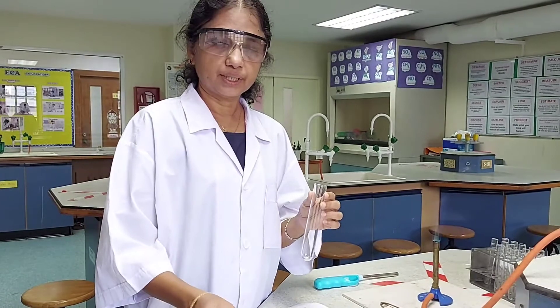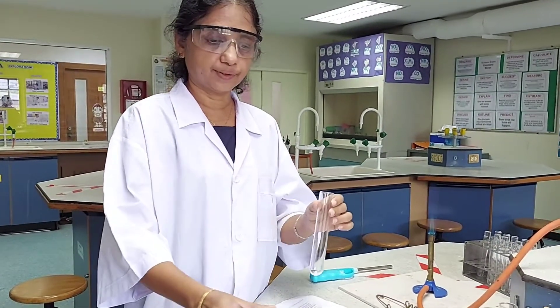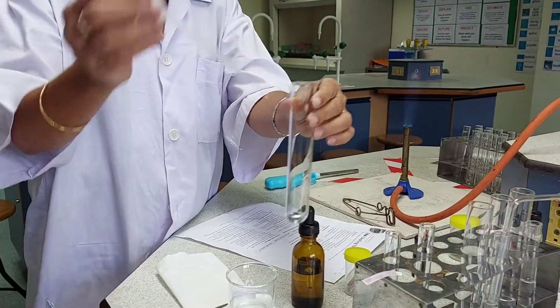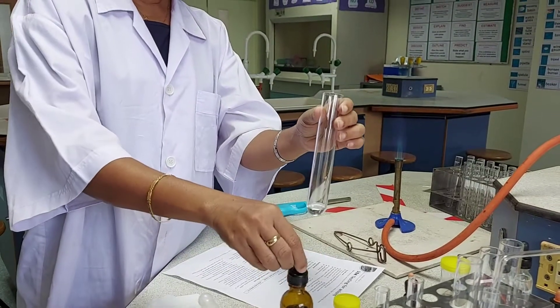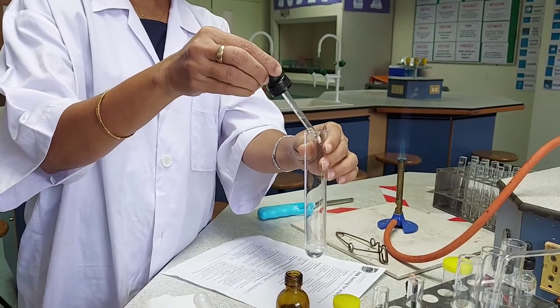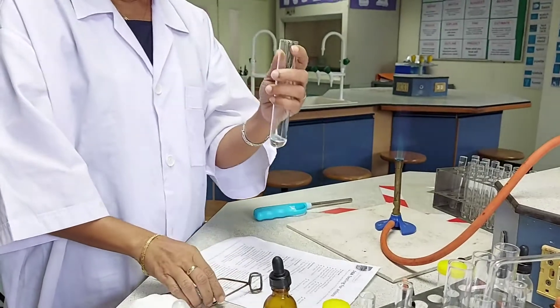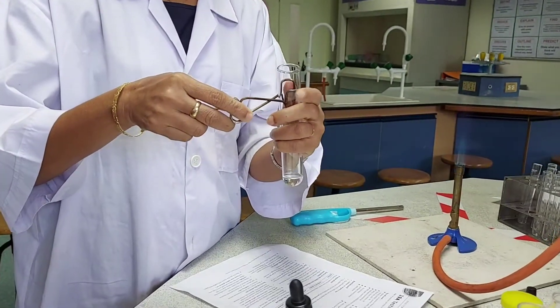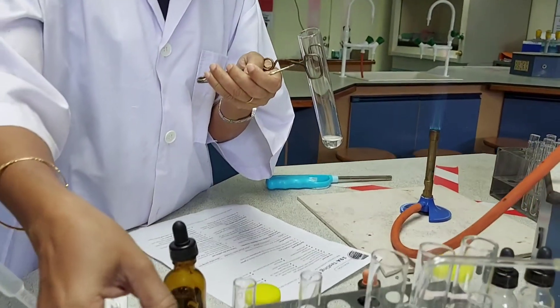This given solution contains sulphite ions, and I am going to test for their presence by taking a few centimetre cubes of the given solution. I am adding a few drops of dilute hydrochloric acid to acidify the given solution. Now this has to be gently heated to get the sulphur dioxide gas evolved from the solution mixture.